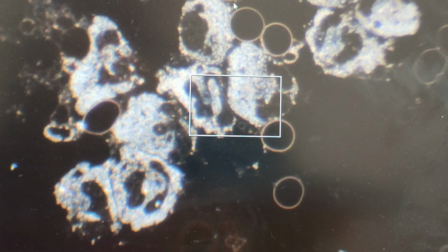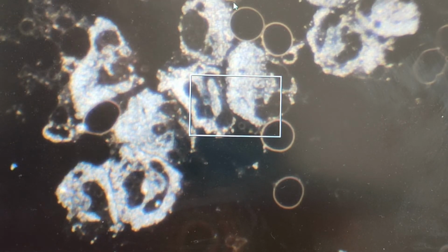So when you see this much activity in a blood sample, it's definitely a sign of immune system activation because of some form of perceived attack or pathogen or toxin, something that's not supposed to be in the blood. And that actually is a very long list of things, and the possibilities are quite huge. So this isn't a diagnostic, this is an observation of what is going on inside this person's body. Something's happening, it's stimulating the immune system, so much so that this is happening in this blood sample even 4 hours later. So on one hand, it's a sign that yes, there is some energy.